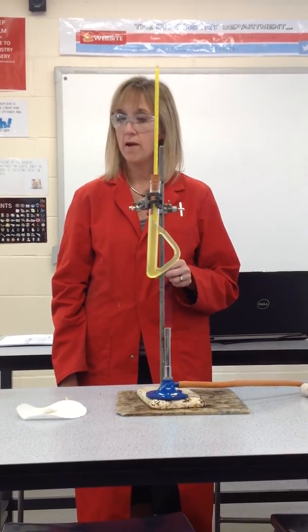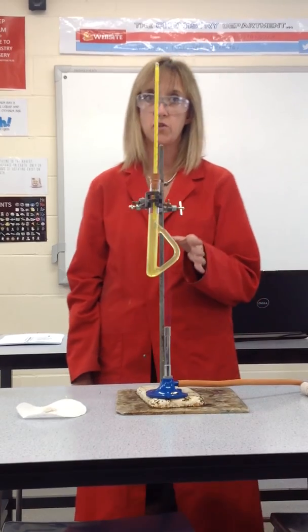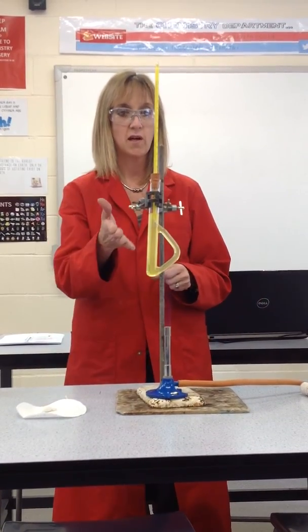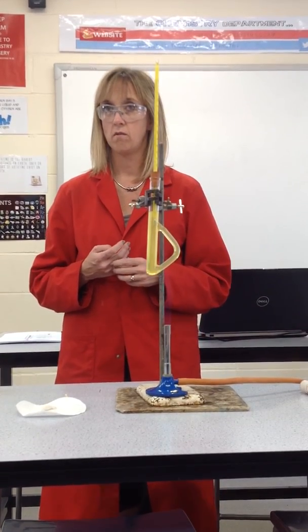When you've finished and the crystals have melted, turn your Bunsen burner off and leave your apparatus to cool. When it's cooled, the dibutyl phthalate can go back into the bottle — it does not go down the sink.